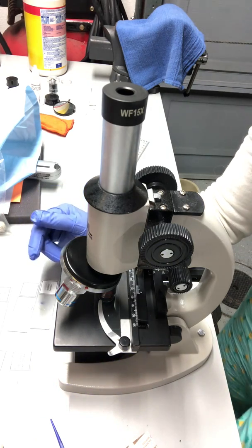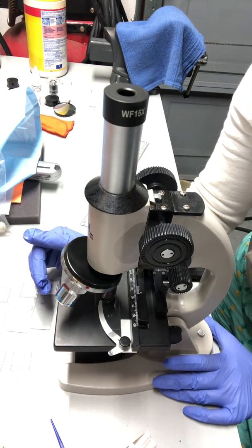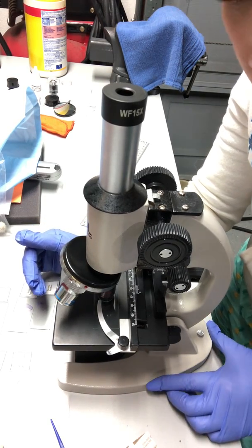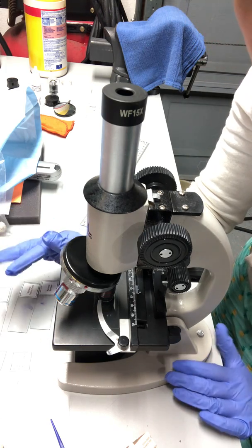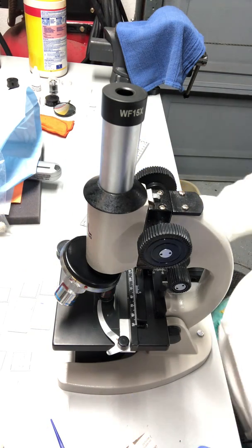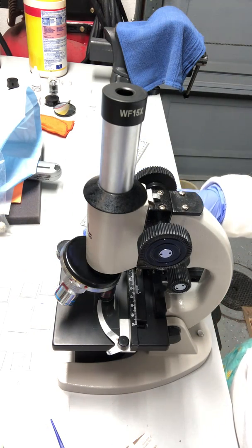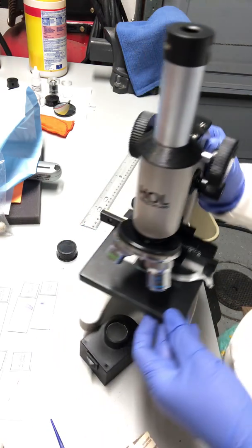Some microscopes are actually, the lens are connected here. I mean, not the lens, I'm sorry. The illuminator is connected to the microscope itself, and those are the more expensive type, and you can just plug it in and the power would come on. And then these are the focus knobs, fine focus knobs, sorry, tilt the camera here.